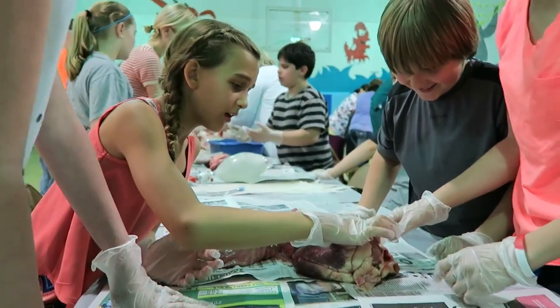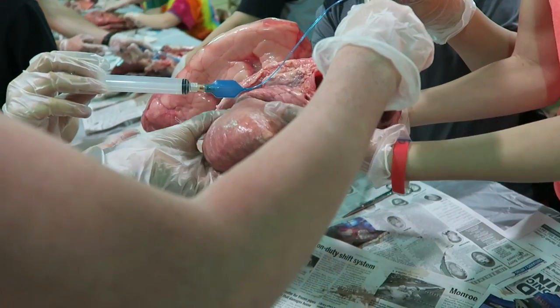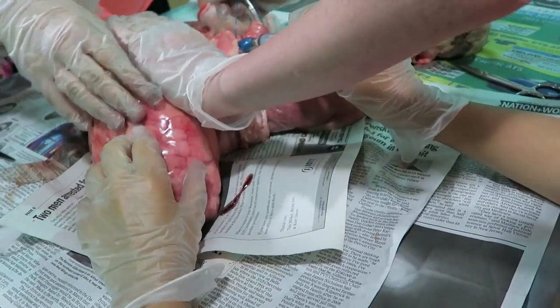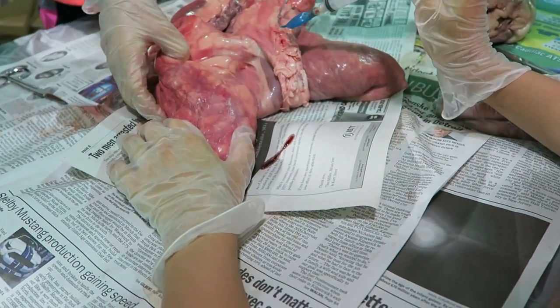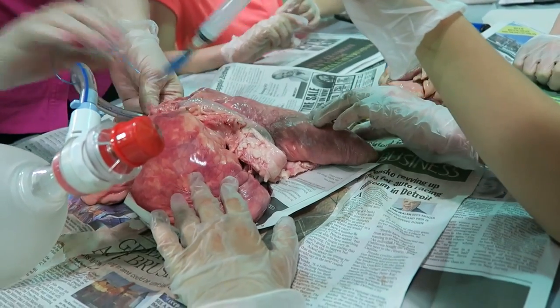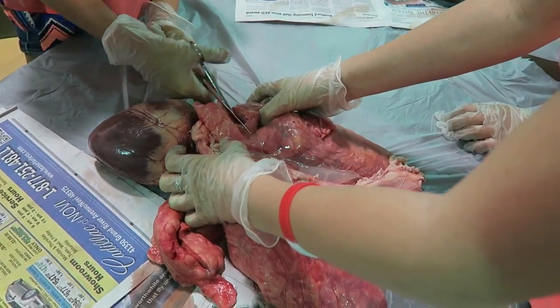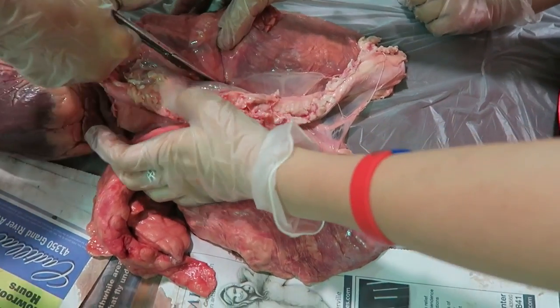We're here at Carly's school and they're getting ready to dissect a heart and lungs. There's another hole here. Someone tries blowing it up — don't blow it up anymore! Can I try it? Hold it. You want blood? Well, you're going to get blood in a second. You need to cut down through it — cut all the way through.